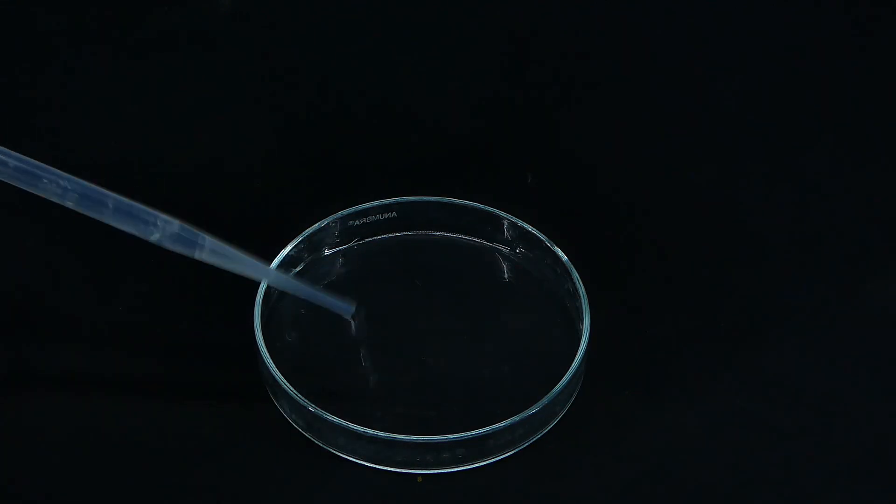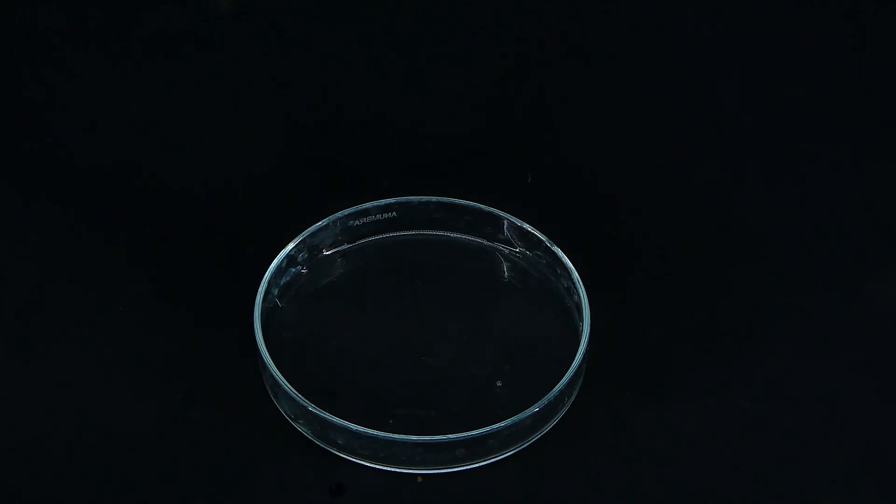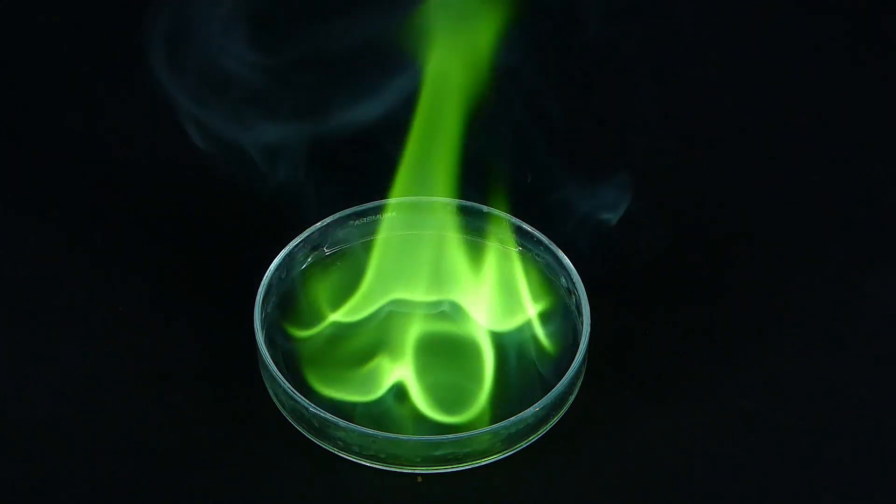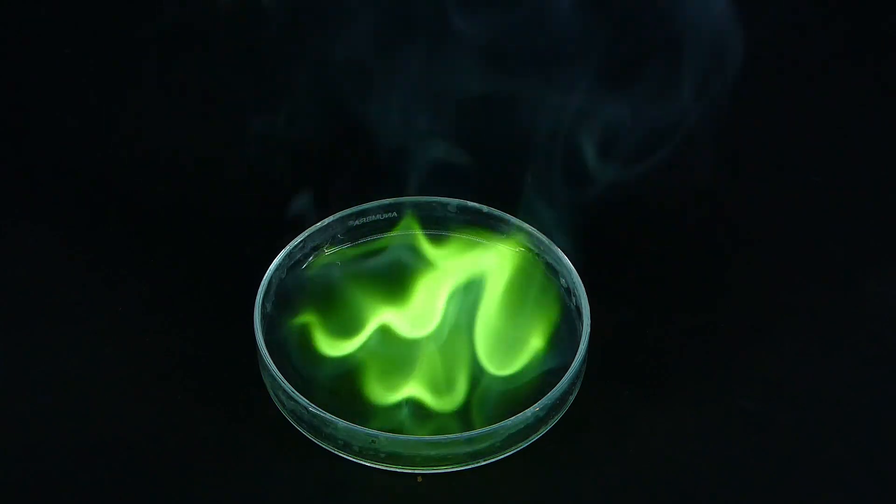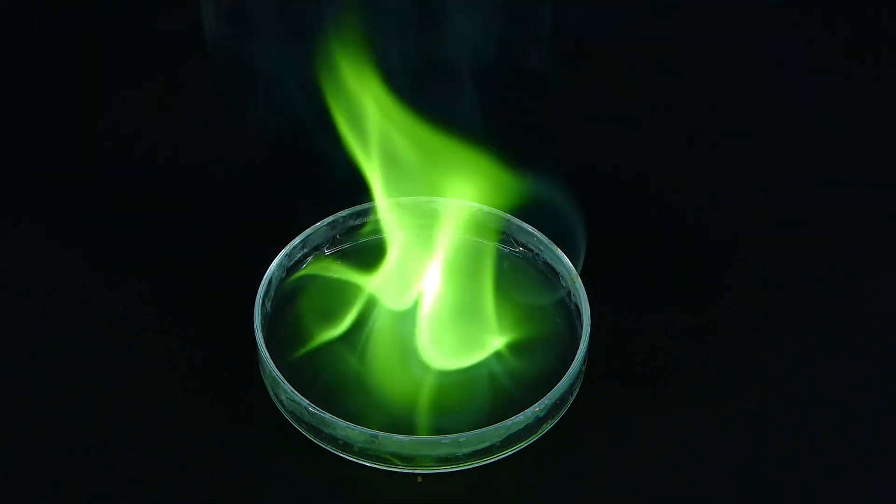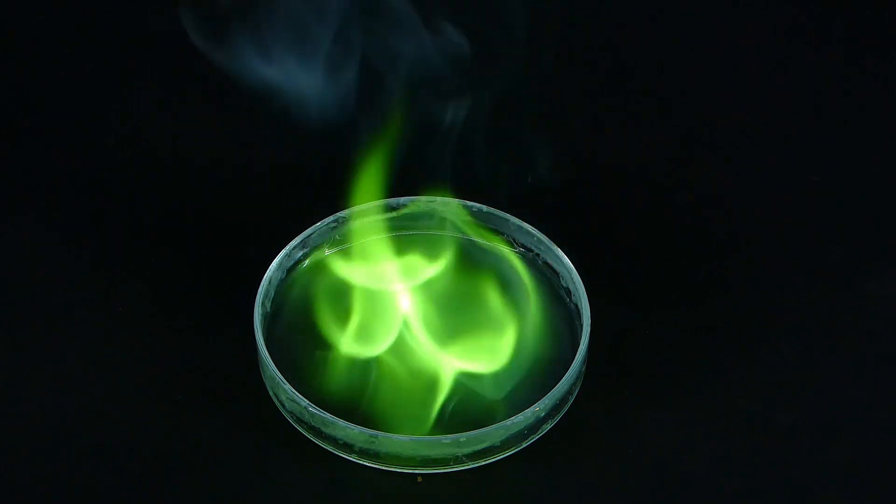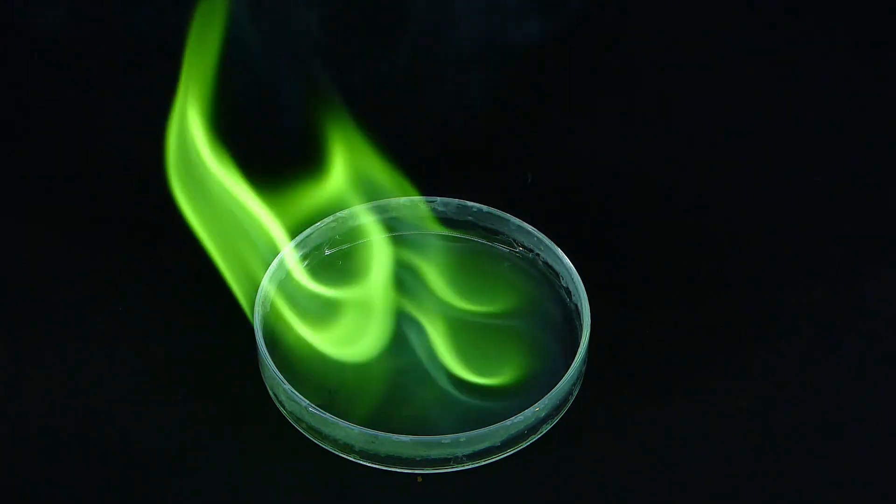So now that I have the trimethyl borate, it is finally time to test it. When I ignited a small amount of my product, it burned to a beautiful and clear green flame, which was really nice, because it confirmed that I am better at chemistry than I was a few months ago.